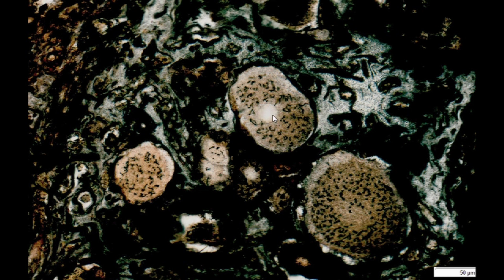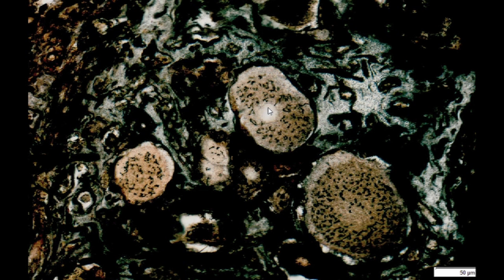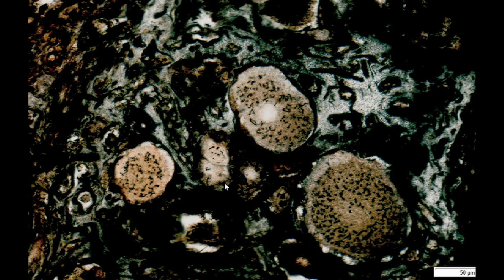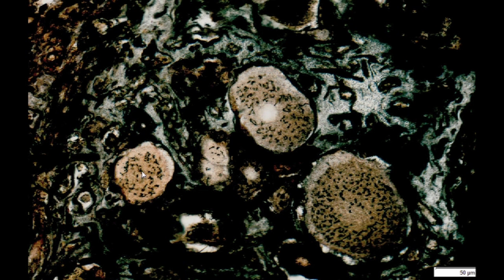This organelle is located around an empty region in the center of the pericaryon. In fact, this is where the cell nucleus is located. Since the cell nucleus does not impregnate with silver salts and the specimen has not been additionally stained, we can only see its location. This is a description of pericaryons in the central cross section through the middle of a neuron. Due to the fact that pericaryons are relatively large cells, we distinguish so-called marginal cross sections, where only dark coloured fragments of the Golgi apparatus are visible without the nucleus.